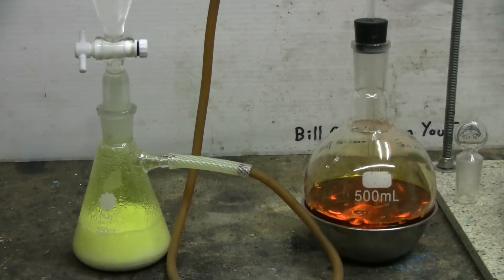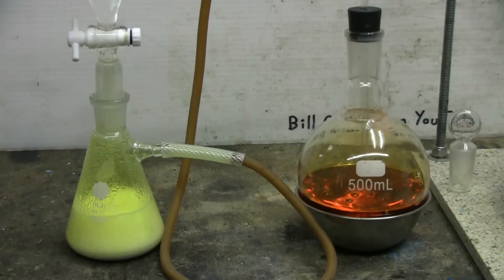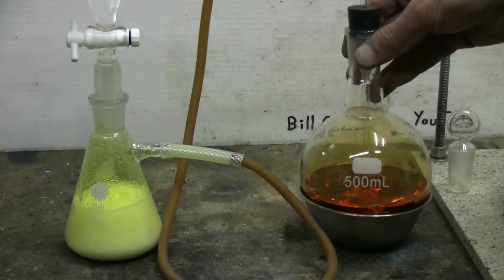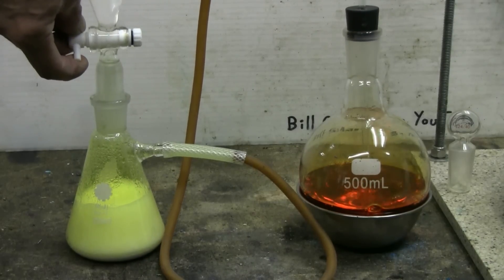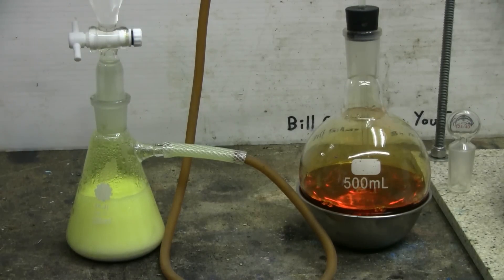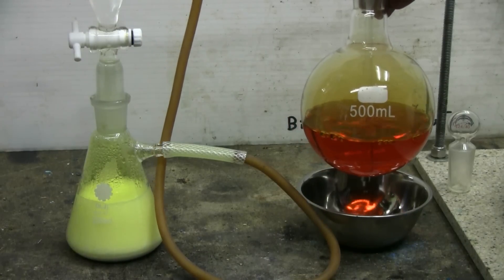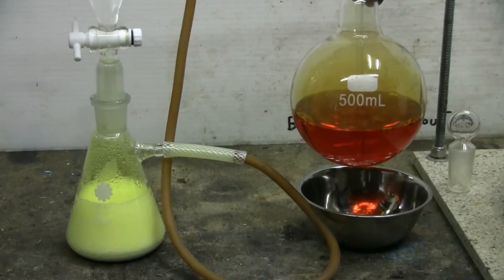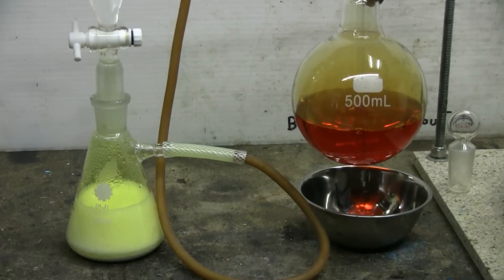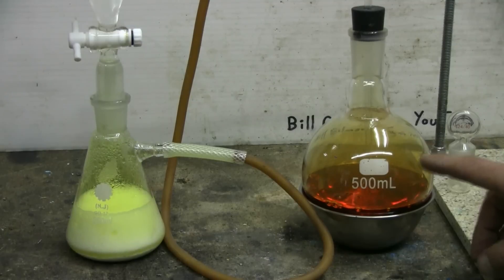We'll zoom in a little better - we just need to see the chlorine being generated and bubbled through the rubber hose and down into our 500 milliliter boiling flask. I can slow down the chlorine a bit by reducing the drip rate of the hydrochloric acid. As more bromine is displaced from the sodium bromide by the chlorine gas, our solution in the 500 milliliter boiling flask continues to darken and become more bromine-like in color. Also, bromine vapor can be seen accumulating inside this flask.